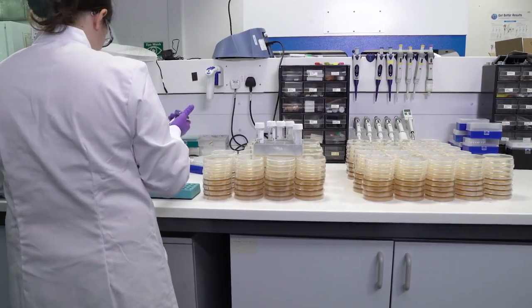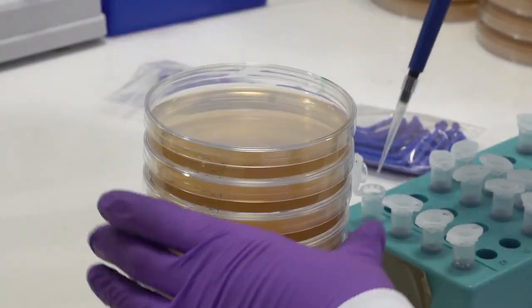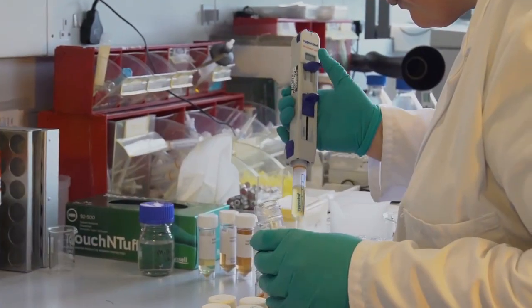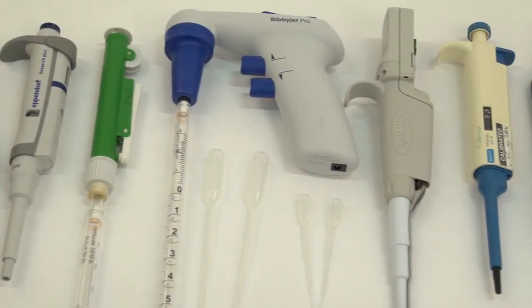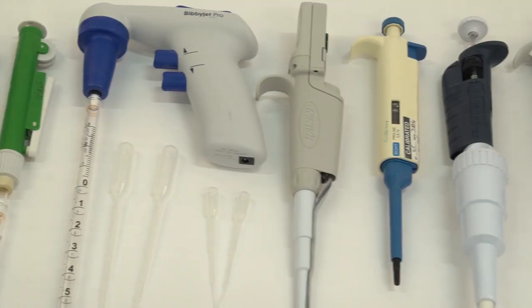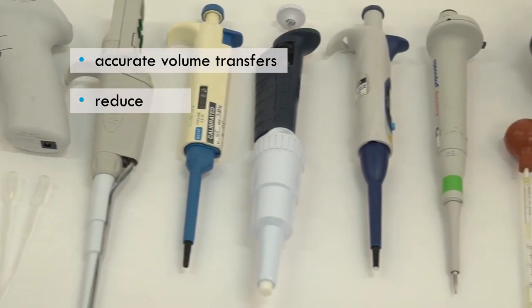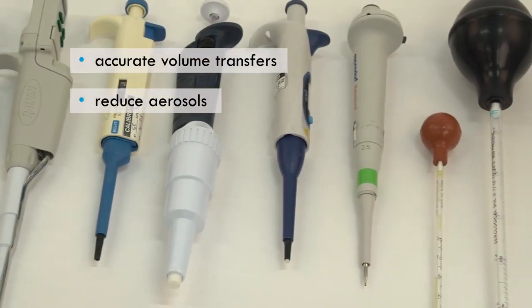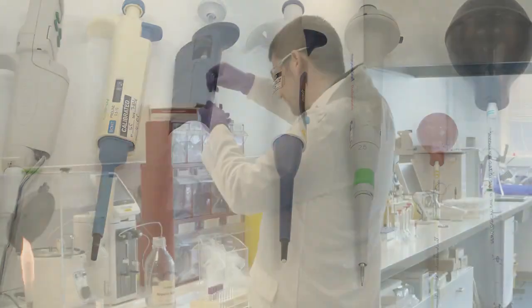Work in a microbiology laboratory involves a lot of handling and transferring of liquids in small, precise volumes. This is mainly done using pipettes. It is important to know how to use them properly so that you can make accurate volume transfers, reduce the numbers of aerosols generated, and prevent contamination of the pipette and subsequent cross-contamination of samples.